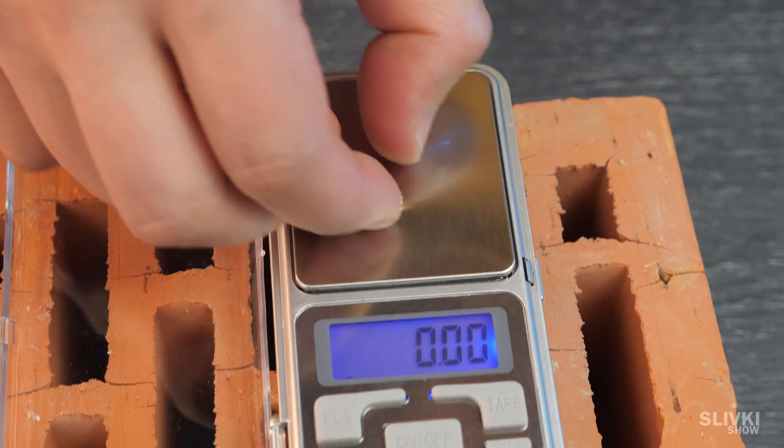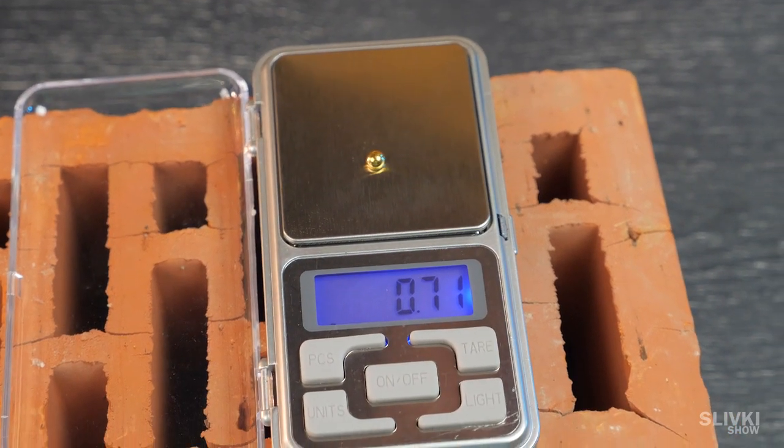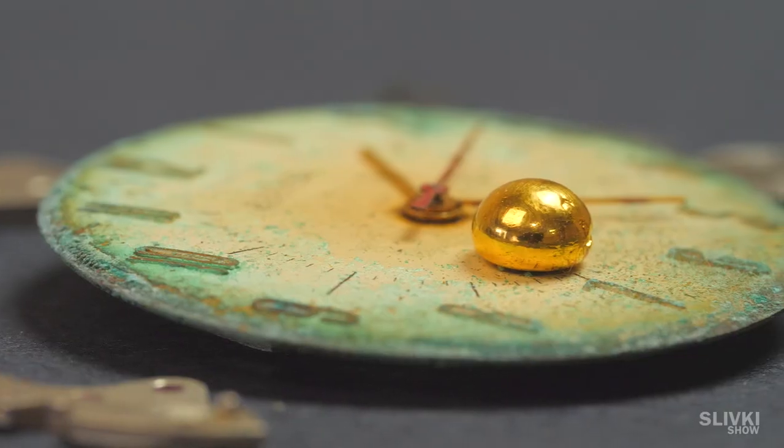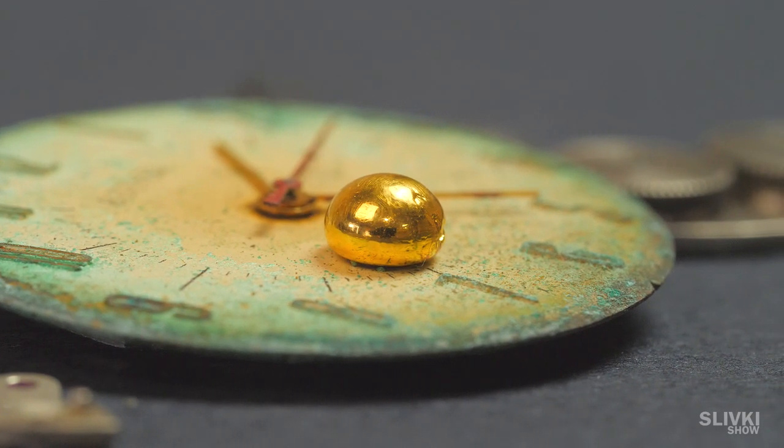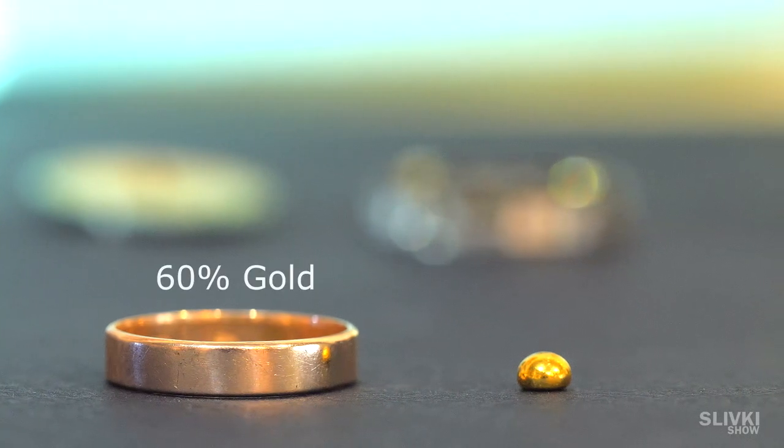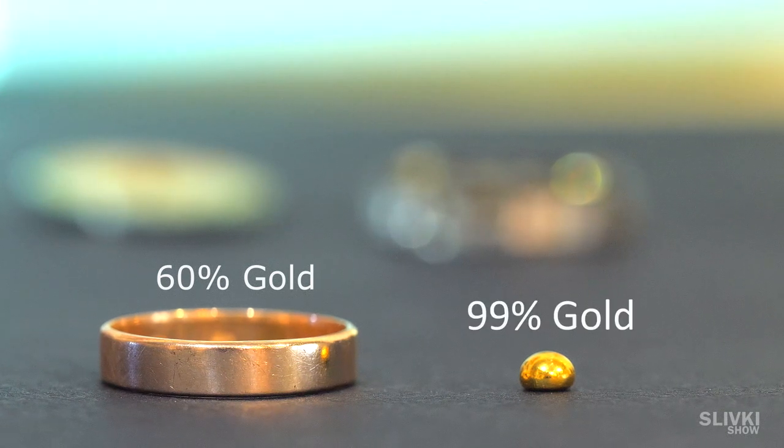You're probably wondering how much it weighs. 0.71 grams. Pretty good considering the fact that the gold has a higher standard, almost without any contamination, unlike gold which is sold in the store.